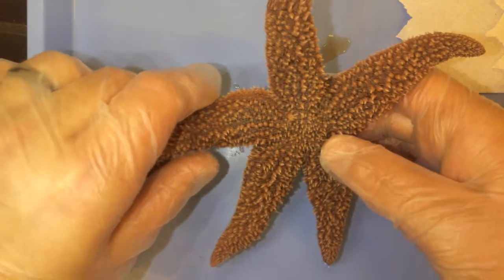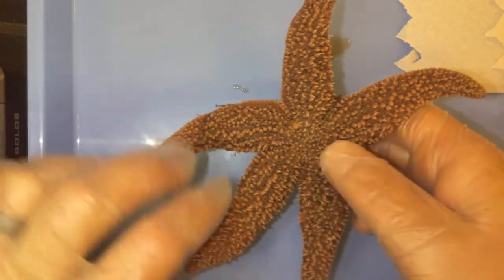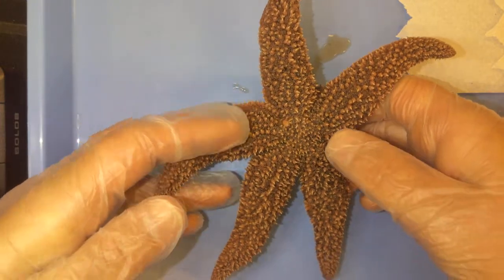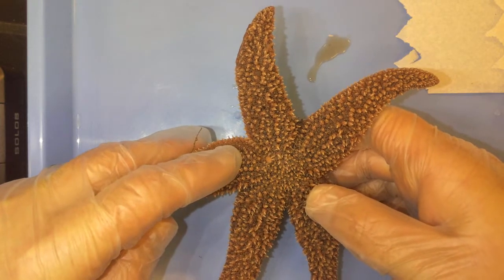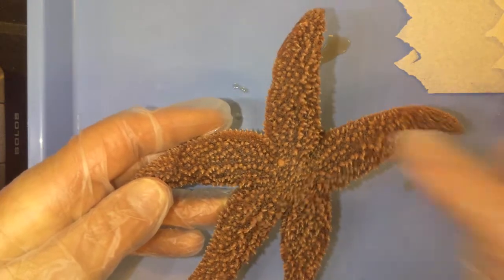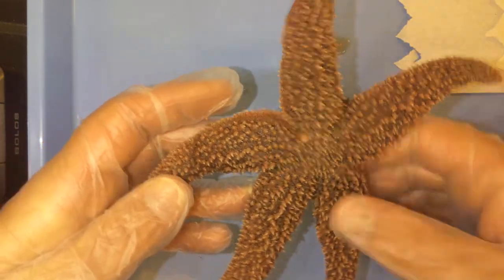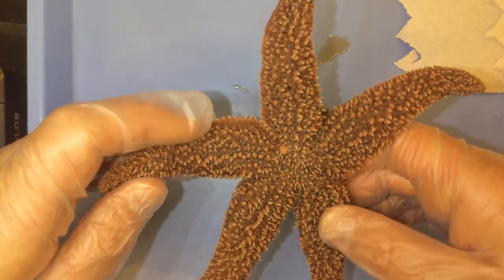So a typical looking sea star. Let's go ahead and talk about some of its exterior features. What we're looking at right here is the dorsal side of the sea star. This is called the aboral side, which means opposite side of the mouth. We see that it has five rays or five arms that radiate out from the central disk area, and this gives it the five-part radial symmetry that we see with a lot of the other echinoderms.